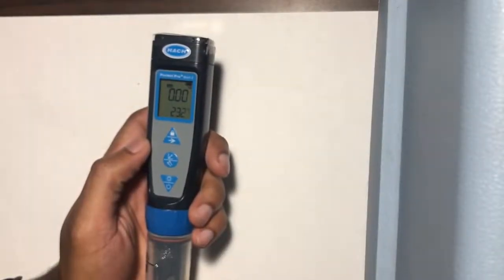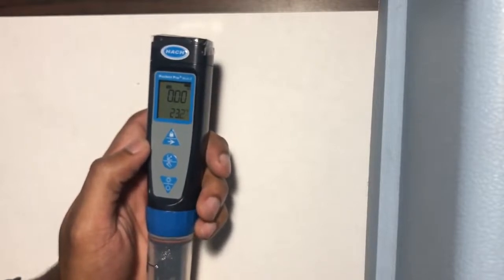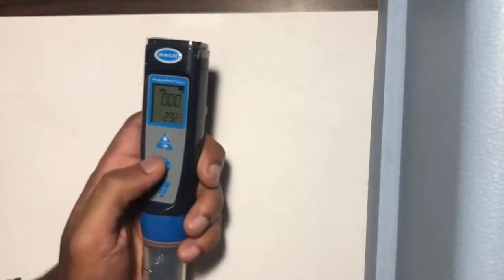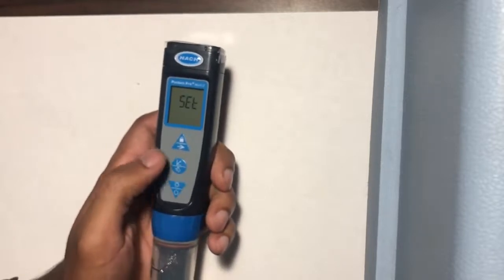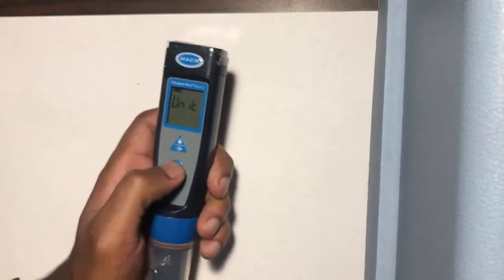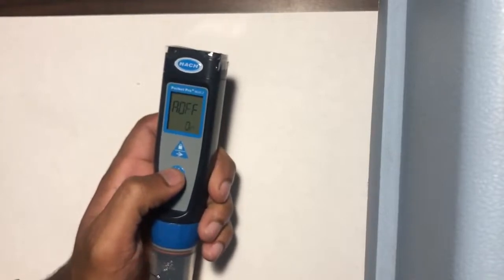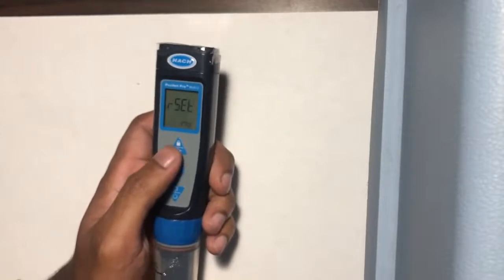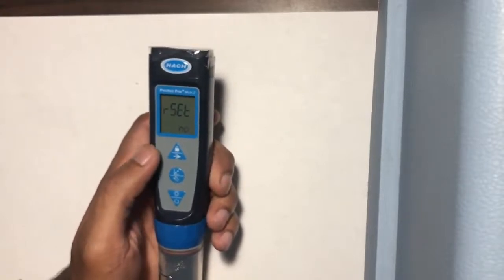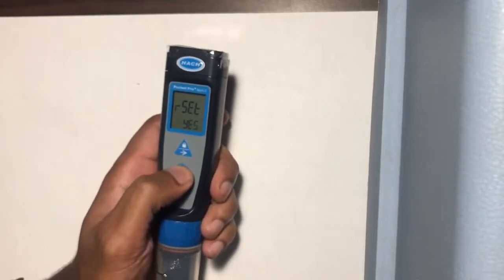As I said, RSET will change these settings back to factory. If you're still having difficulty and the Hach refuses to cooperate, try and give it a hard reset. To reset, hold down the middle button to enter settings mode. Once in settings mode, tap the middle button until you reach RSET. Tap the top or bottom button to scroll up to yes, and hold the middle button until you see END.